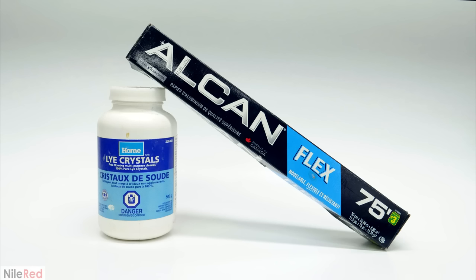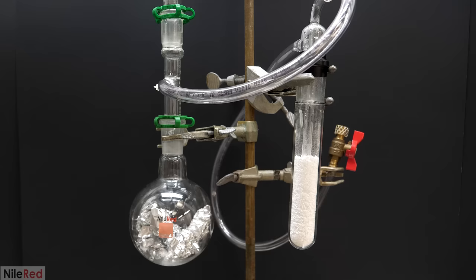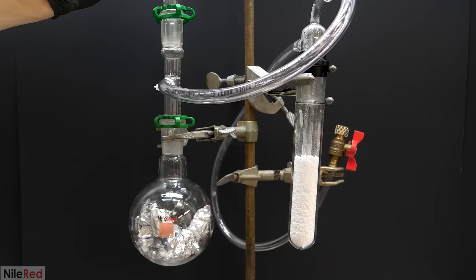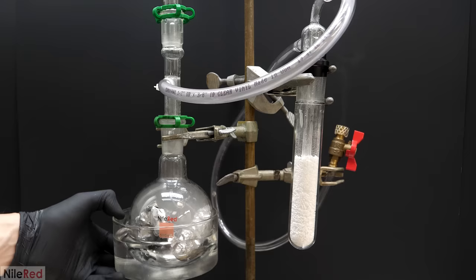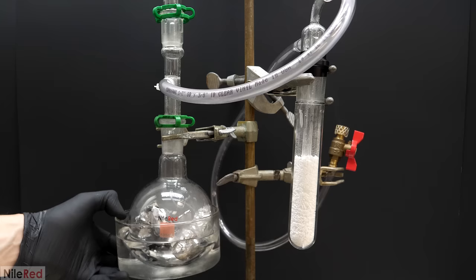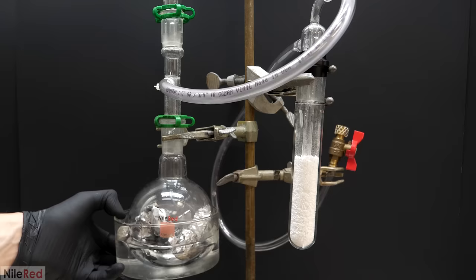However I didn't just have a tank of it lying around or something and I had to make it myself. In a lab setting there are several ways that this can be done but I found that for me the easiest one was always just to mix sodium hydroxide drain cleaner with aluminum foil. This was the setup that I put together which at first might look a bit complicated but it's really not that bad. The basic idea is that the flask is filled with aluminum foil and then above this I've attached an addition funnel. In this funnel is a whole bunch of concentrated sodium hydroxide solution so when it's opened it'll all start dripping on the aluminum foil. When they come into contact they'll start to react and they'll produce hydrogen gas which will be pushed out of the flask. It'll then move through the plastic tube and into my trap which I've filled with calcium chloride.